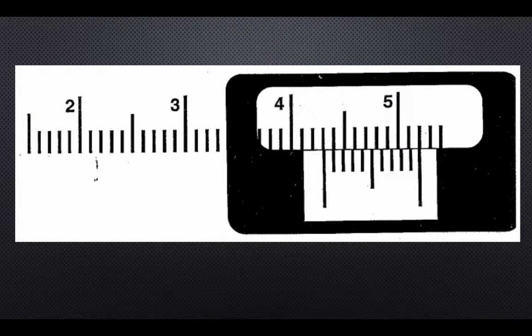A caliper will have a little window, and you're going to use the markings inside of that window to determine what the measurement is of the substance you're testing. First off, we need to know how to get the digits in the value that we're measuring. Well, these larger numbers here, the larger lines, those are the digits for the ones place. So those markings are going to allow you to find your ones place.